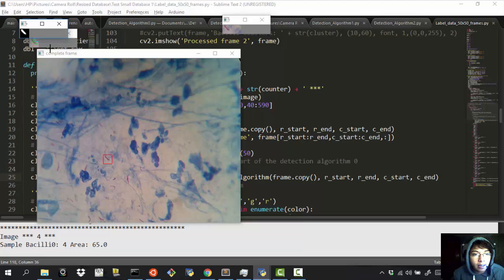If I press theta, then the algorithm classifies this as a bacteria. Why didn't it classify this? Perhaps because it looks more like a circle and it's not well defined, so it's better not to classify this as a bacteria and to classify it as a fuchsin precipitation. If we come here, we have another one. Of course, this is classified as not bacteria because it does not have enough size. Then we can move here. This is classified as a bacteria. Then this is of course a bacteria, so we will classify this, and so on.